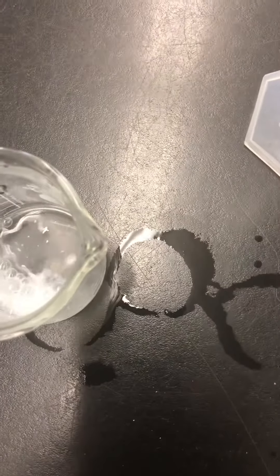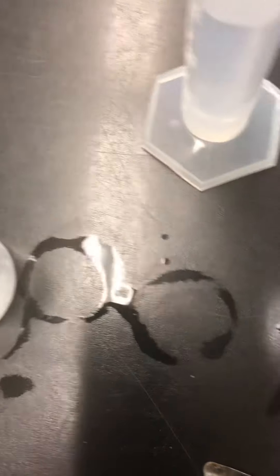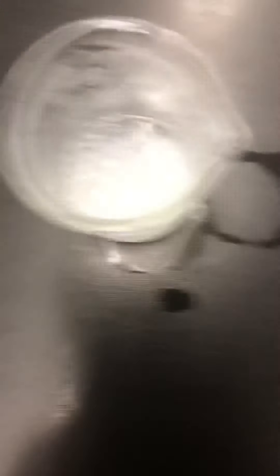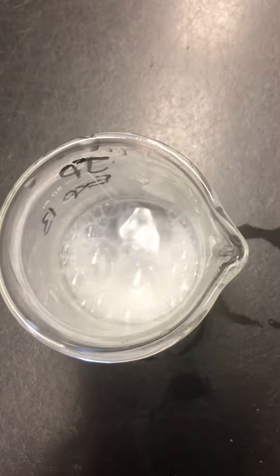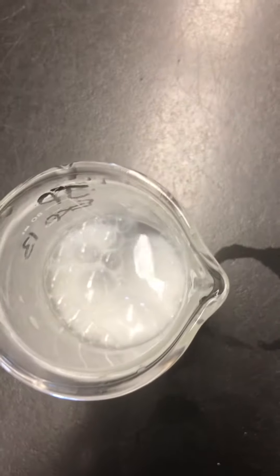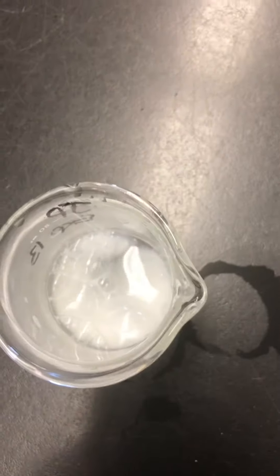Now I am going to add acid. I thought I was going a little crazy right now. Okay, that's still the water. And this one — I'm going to add acid. Over here is when we add acid.